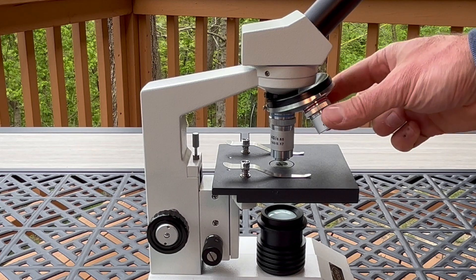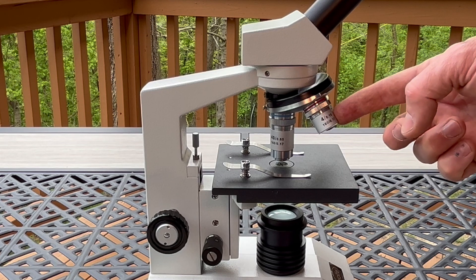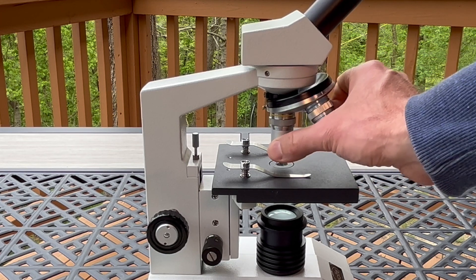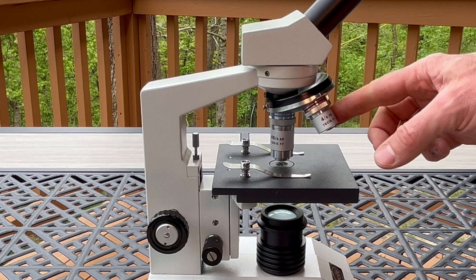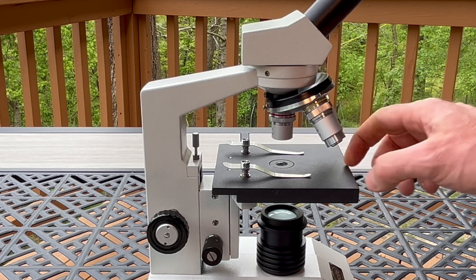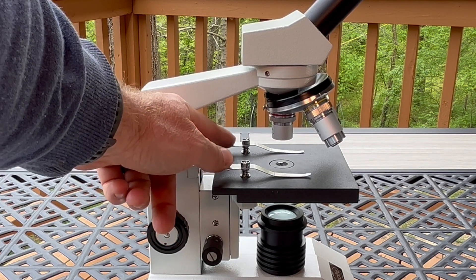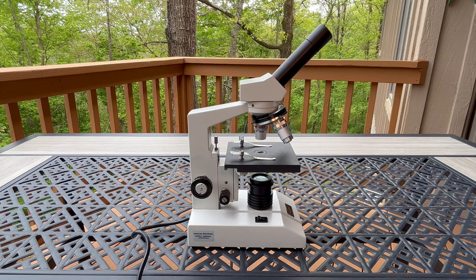The objective lenses each provide a different level of magnification. The shortest objective lens has a magnification of 4, the medium has a magnification of 10, and the largest has a magnification of 40. The objective lenses look down through the hole in the stage. The stage is where you place your specimen on a slide, which goes underneath the stage clips. The stage clips can be manipulated by pressing the back of them.